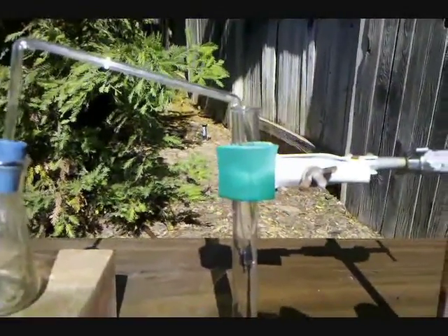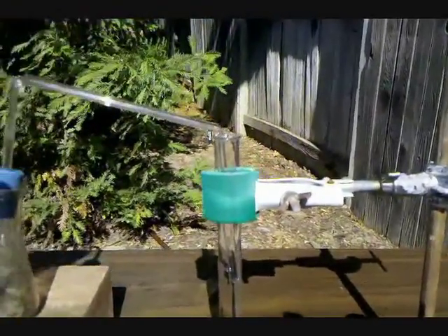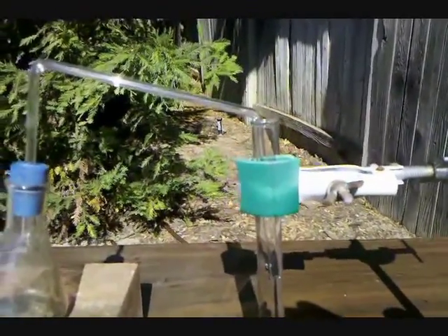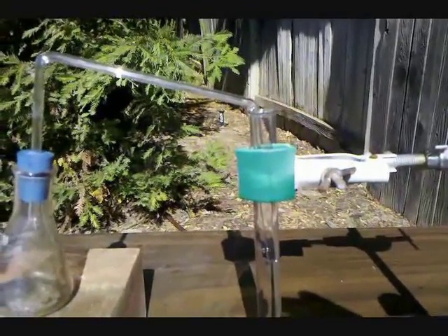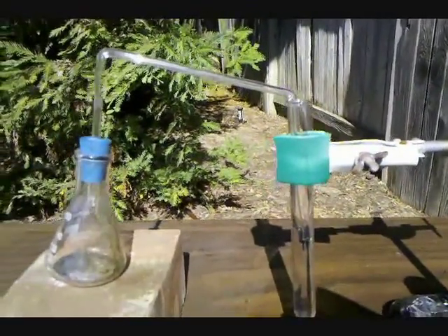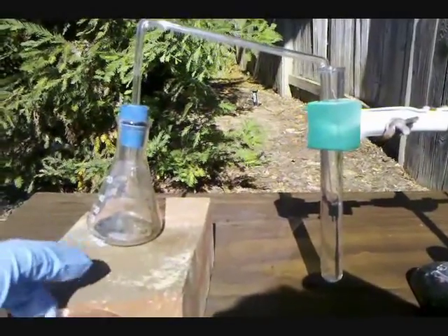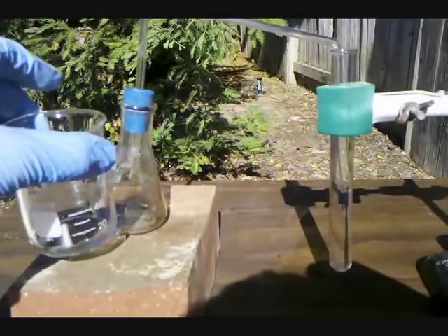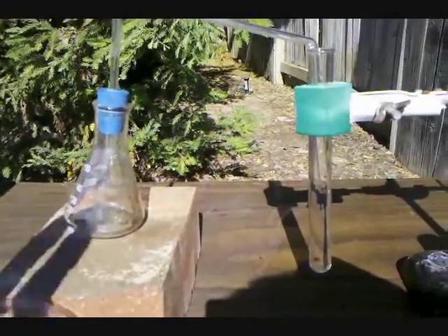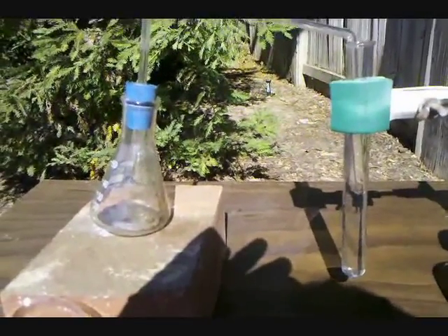I would expect to see a lot of black carbon coming out of the top. The reaction is pretty exothermic and might light the highly flammable acetylene gas. I'm going to get back to you after the hydrochloric acid has been added to the Erlenmeyer flask and calcium carbide has been added to the test tube.